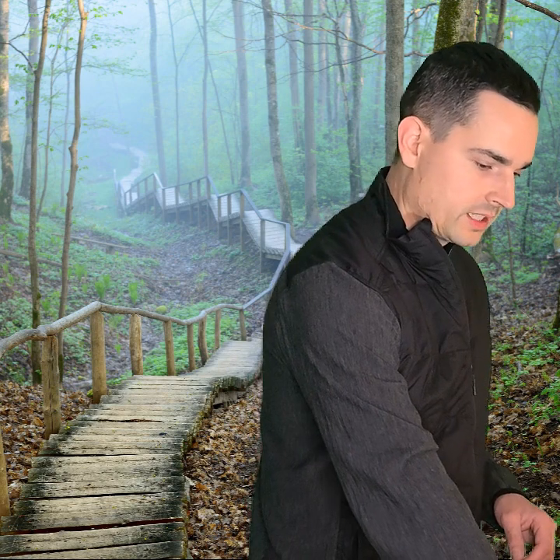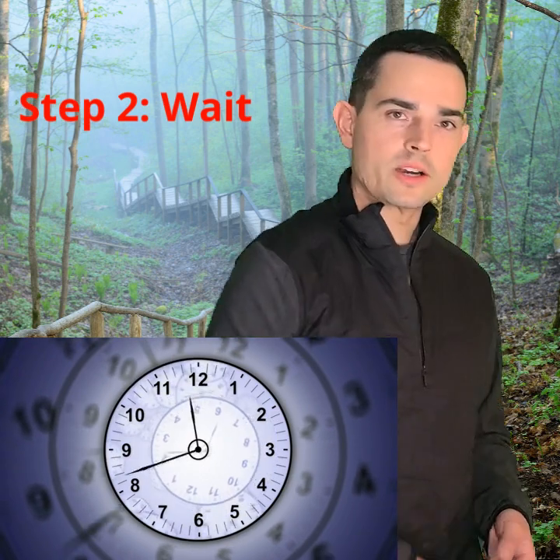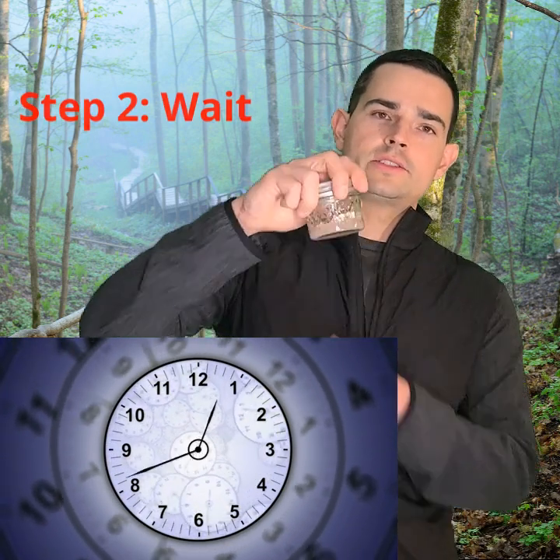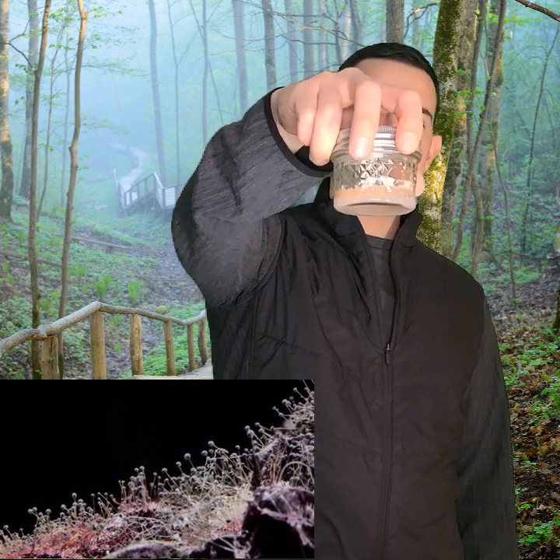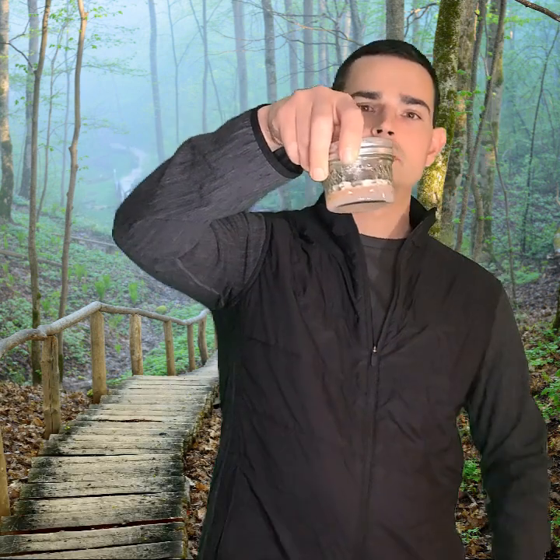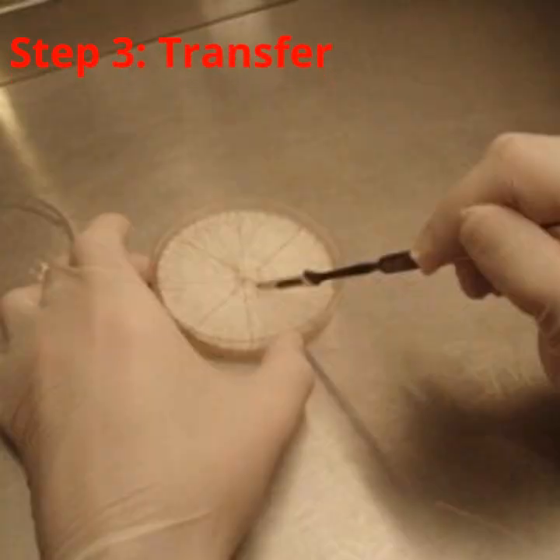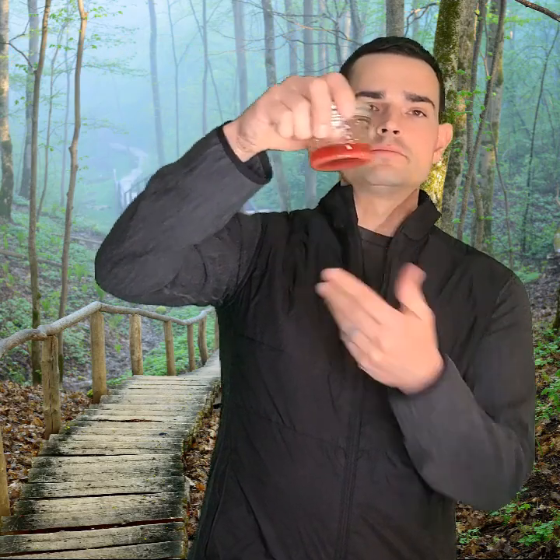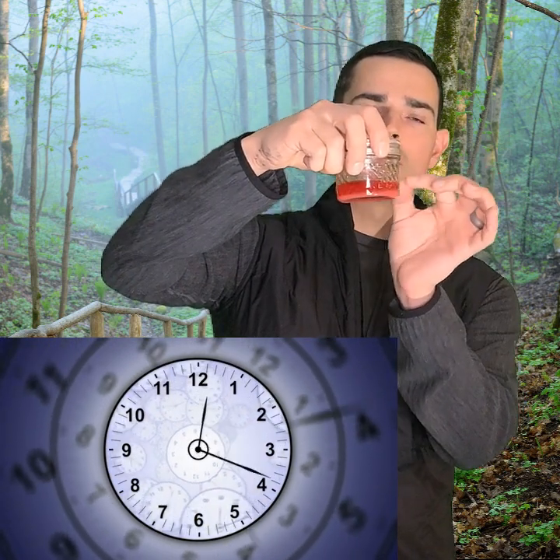So let's say you inject in here and you have it in your agar. In about a week or two you're going to have a jar like this — you can see there's some mycelium growing in there. You're going to want to cut the section that looks the best and strongest, cut that out, and make a transfer into another empty agar plate, and essentially start the process again. The mycelium is going to grow more consistently.